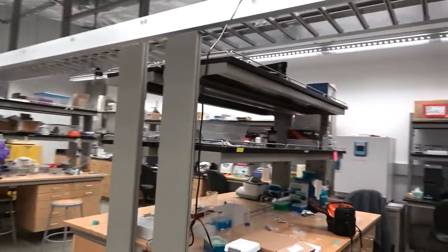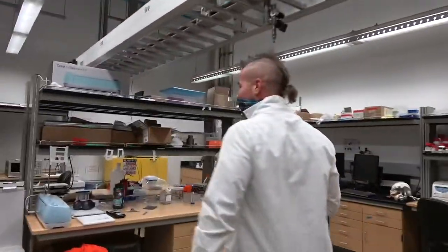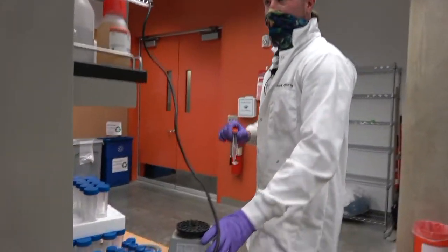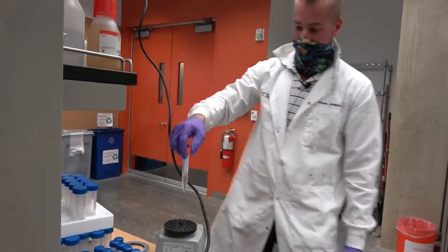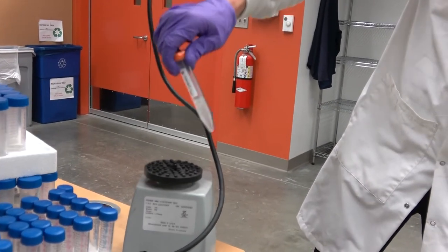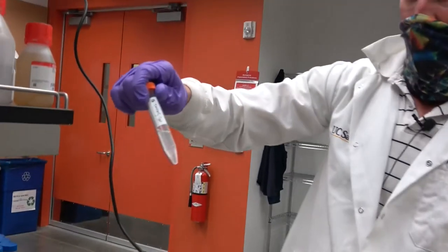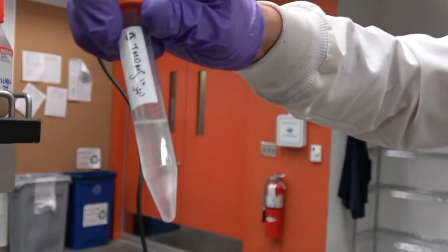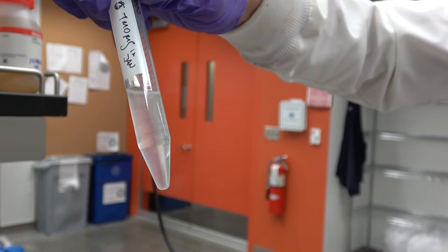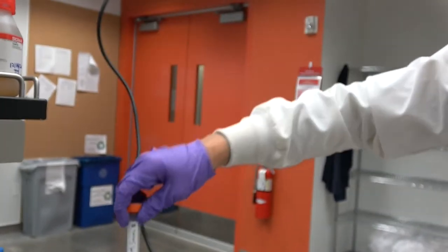Vortex briefly. What's a vortex? Let's see if we can find it. There it is. This is called a vortex and you basically just push down on it and it's going to shake the hell out of it. It's a little bit cloudy because I've made an emulsion, but if we give it enough time, it will definitely settle out again because these are completely immiscible materials.